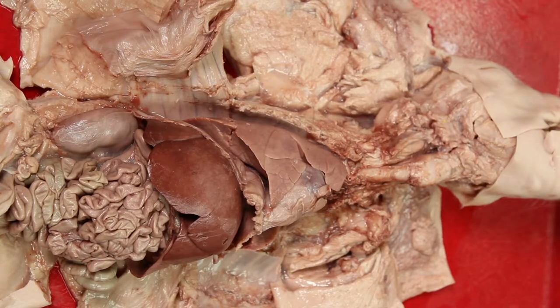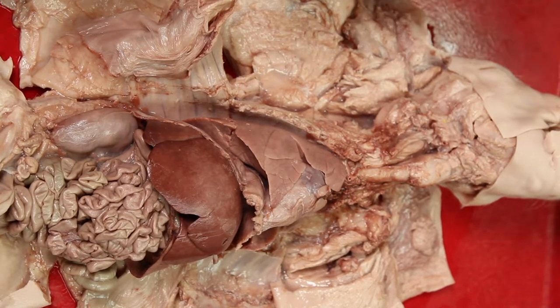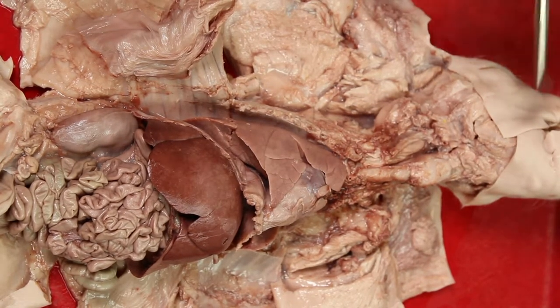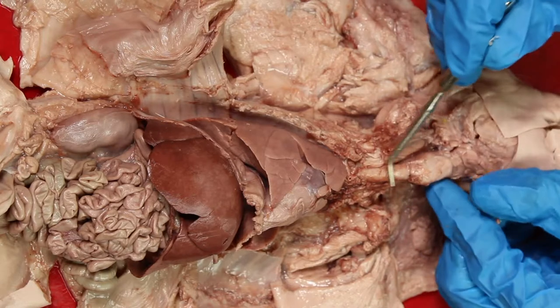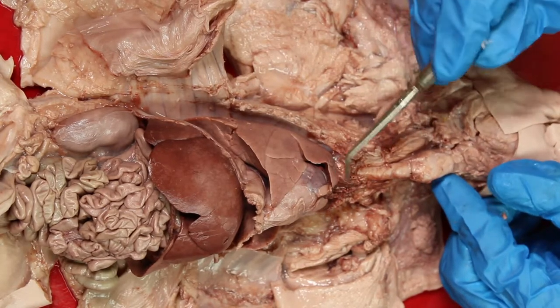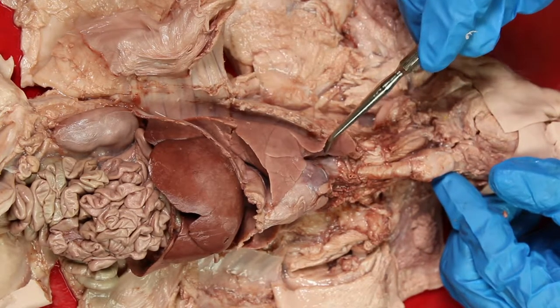The function of the lungs is to extract oxygen from the atmosphere and transfer it into the bloodstream, and reciprocally to release carbon dioxide from the bloodstream into the atmosphere.